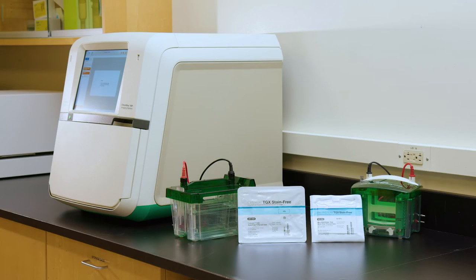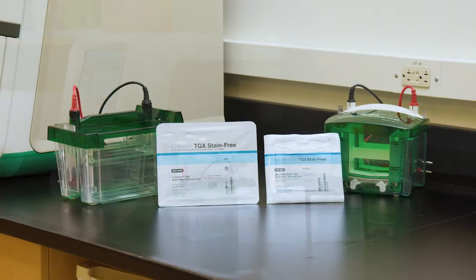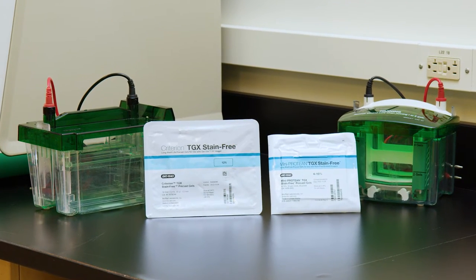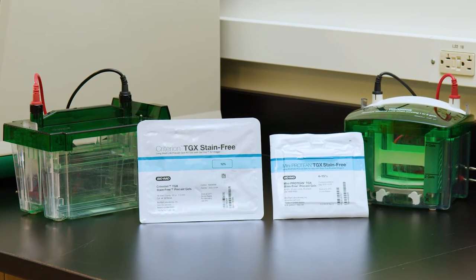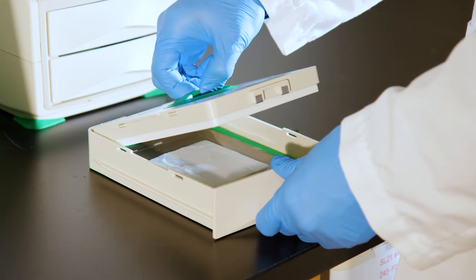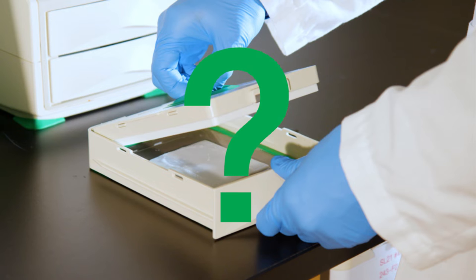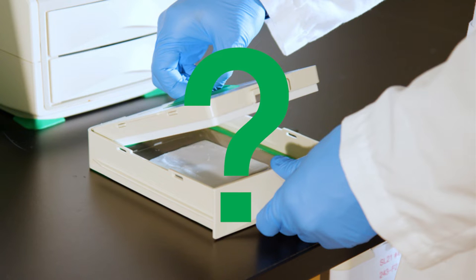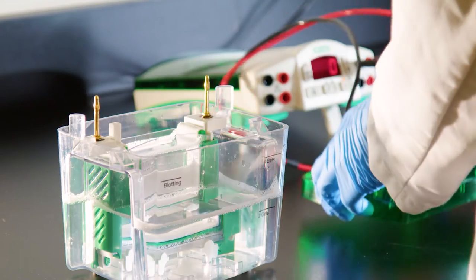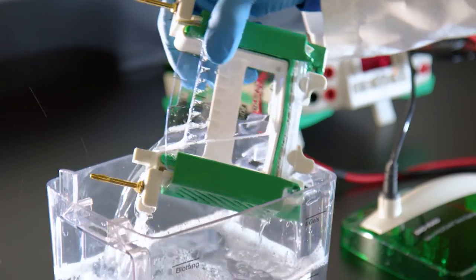In this video we will show you how to use stain-free gels in a Bio-Rad gel imaging system to quickly assess Western transfer efficiency and overall transfer quality. After transfer of your proteins from the gel to a membrane, you may wonder whether the transfer was complete or whether stray air bubbles may have interfered. With stain-free gels you can evaluate protein elution from the gel and confirm proper transfer.